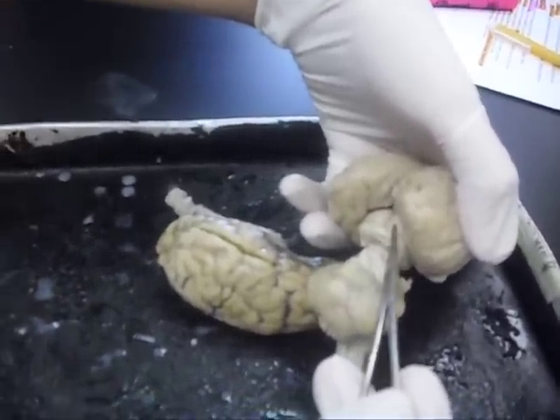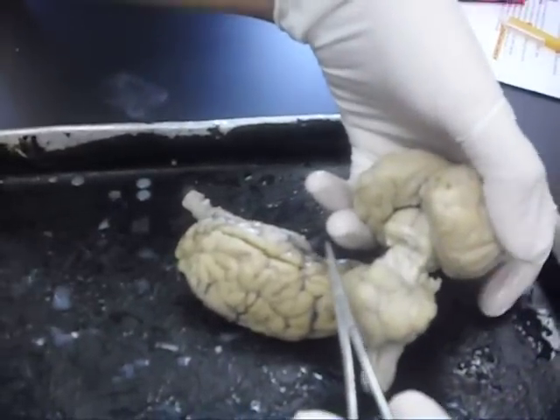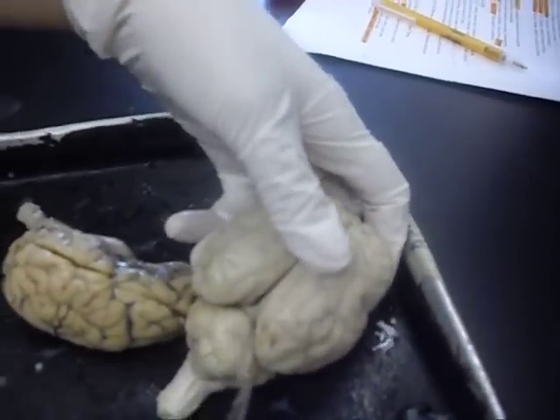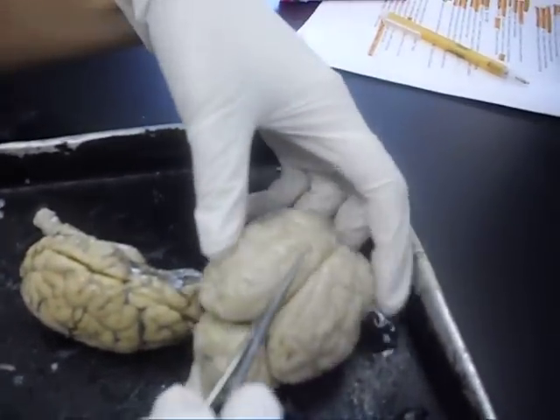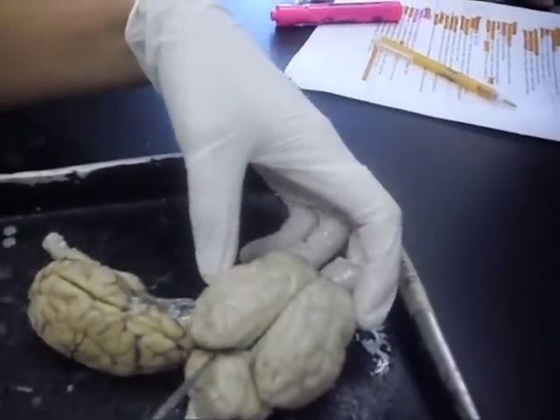Superior, inferior. Your transverse fissure, your longitudinal fissure, your left and your right hemispheres.